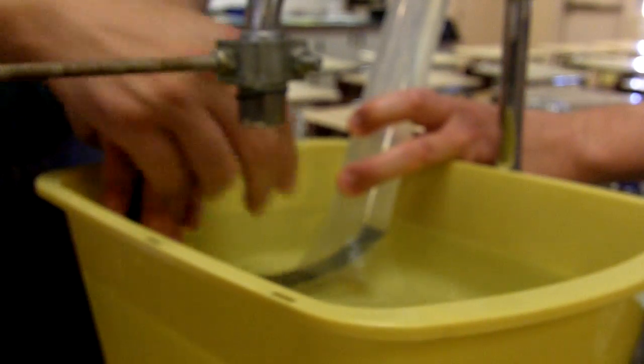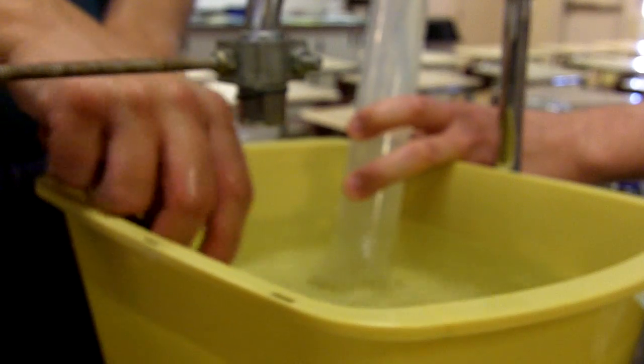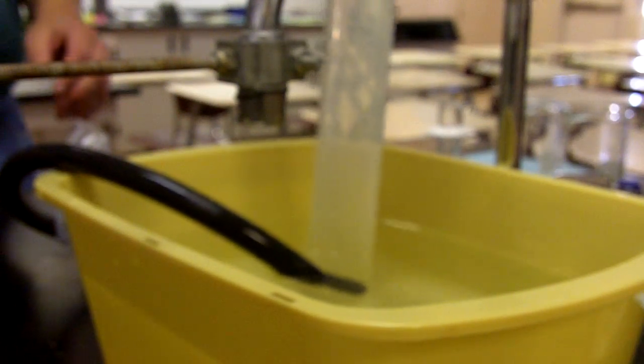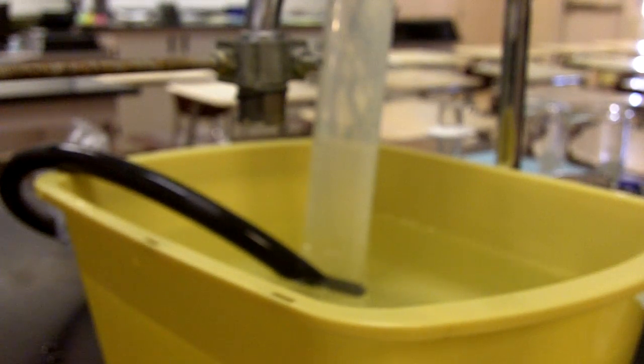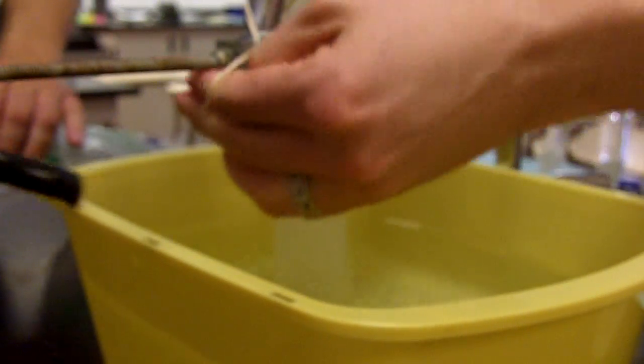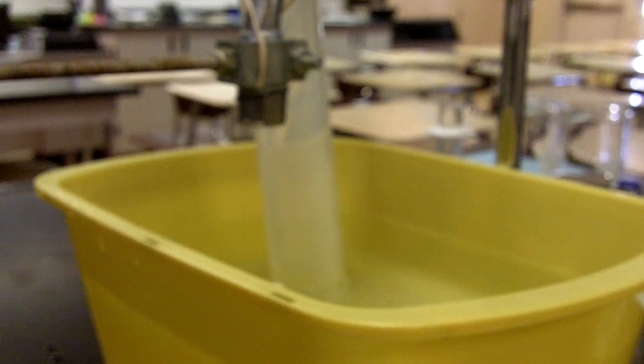So pulling out the tubing while not letting the graduated cylinder break the surface, we have our volume of gas reading kind of from an upside down position. It says to measure to the nearest tens place, and that would put us at 60 milliliters. 60 milliliters of carbon dioxide gas measuring to the tens place. So then that value to be recorded as that last value in the small data table up above.